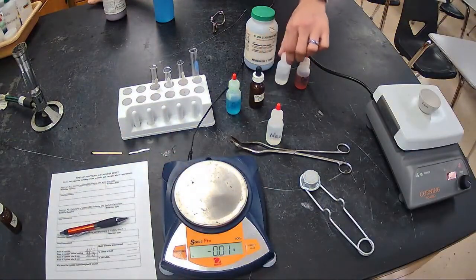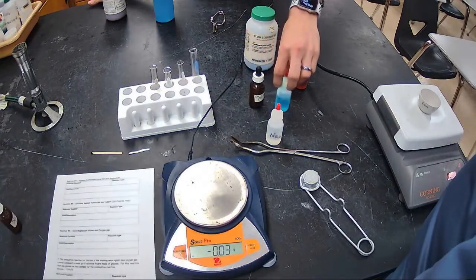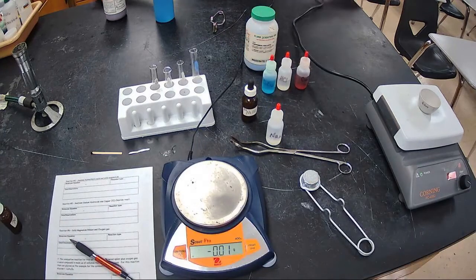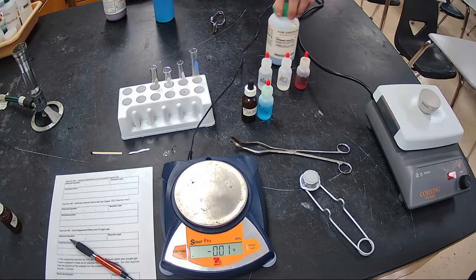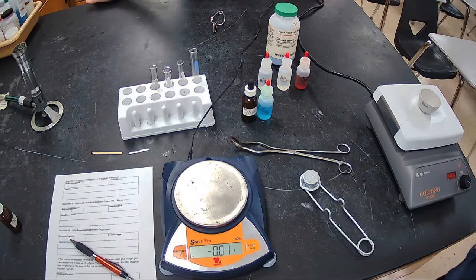Okay, so we finished 4 of the reactions so far. Reaction 1, 2, 3 we're in the middle of. We just finished 4, which was aqueous hydrochloric acid and solid magnesium. Make sure you write your equations for each one of these. If we haven't talked about it, you're writing a chemical equation for each one of these. You're balancing it, and you're using states of matter. So everything that we've talked about so far, you're doing all of those together. Right? Correct states of matter, correct equations, balance them, and then make sure you write down your observations, and then tell us what reaction type we are dealing with. So you'll be answering all those questions here with the lab.